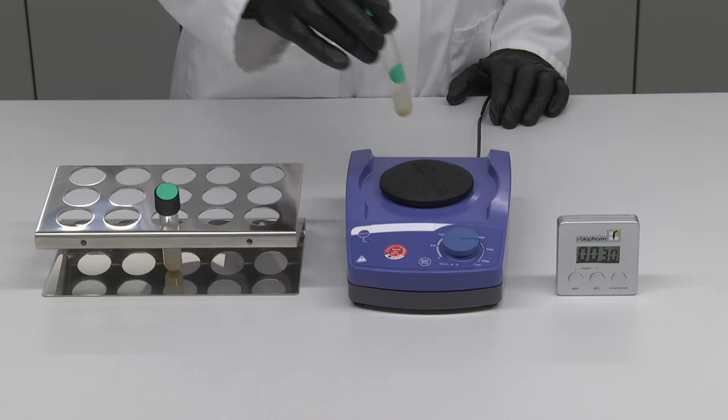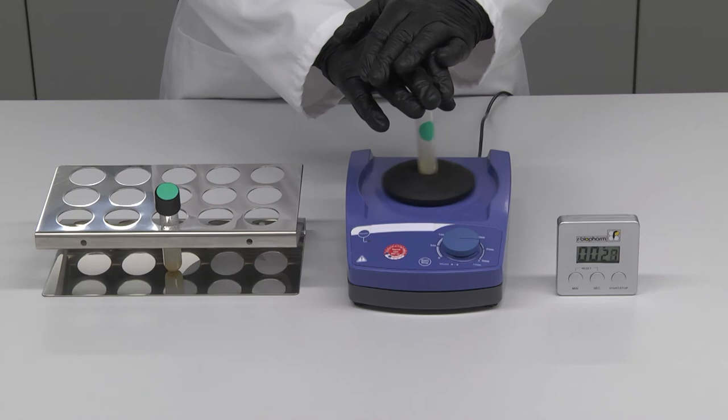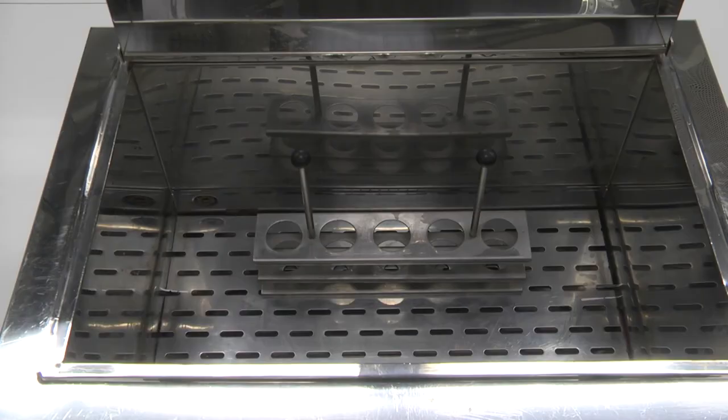Shake well for at least 30 seconds. Everything should be dissolved, otherwise continue mixing. Incubate for 40 minutes at 50 degrees Celsius in a water bath.